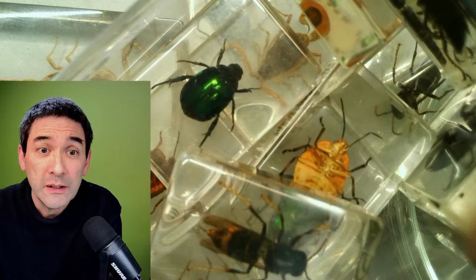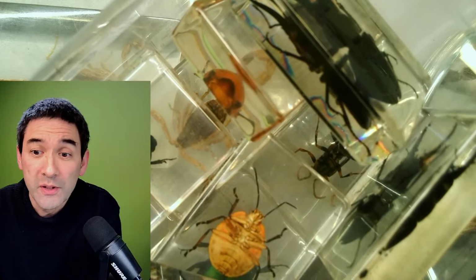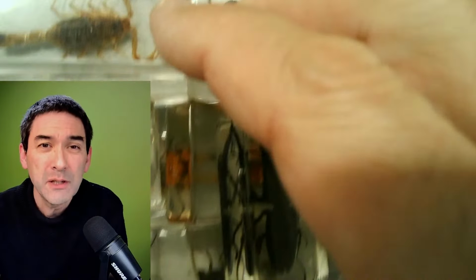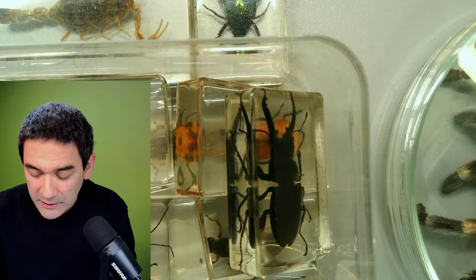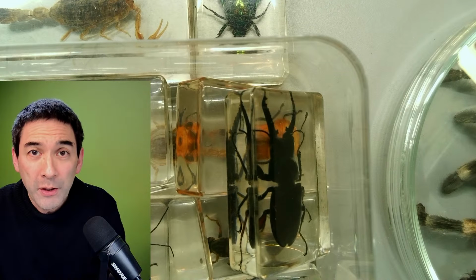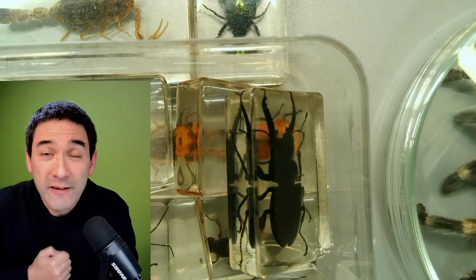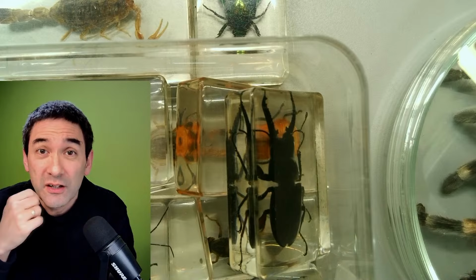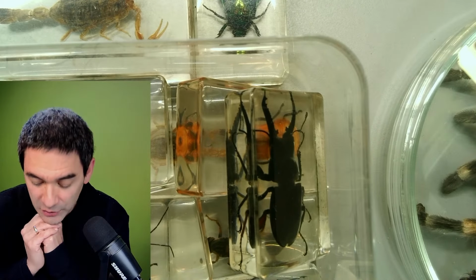I'm a teacher in school, and I thought I'm just going to show them to you, and we're going to put a few of them under the microscope as well, because stereomicroscopy is also sometimes a little bit underrepresented. I have also prepared a couple of other specimens and samples for the compound microscope. For example, I shaved myself, because in the last live stream somebody wanted to see a cross-section of hair, and if you put some shavings under the microscope, then you can actually see the cross-section. So there are a couple of things that we can do today.